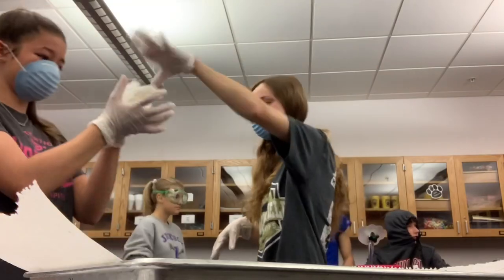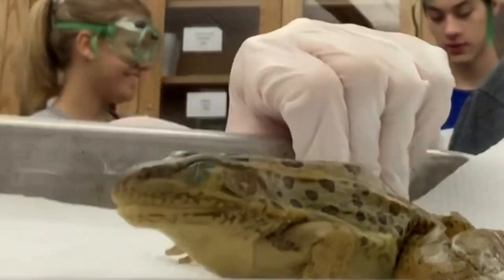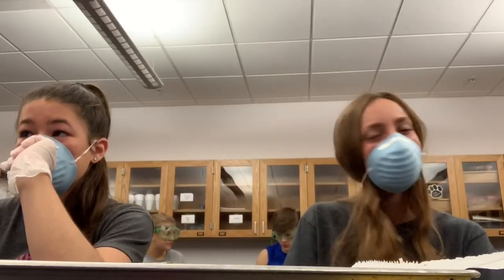I already passed back your papers from yesterday — F and D. We'll have a lab practical again tomorrow, just like we did before. This smells so bad. You only need to turn in one of these, okay everybody. Grab your frog — it comes up just like that. Make one little snip. You're only cutting the skin.